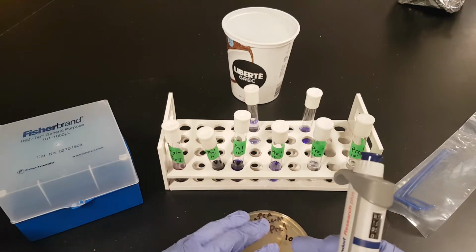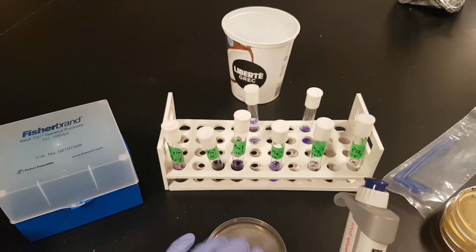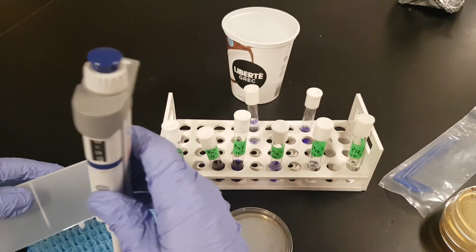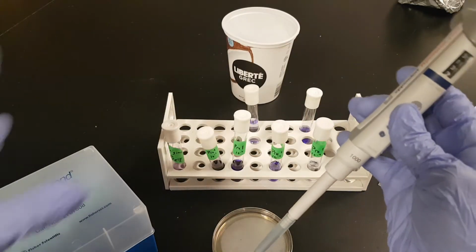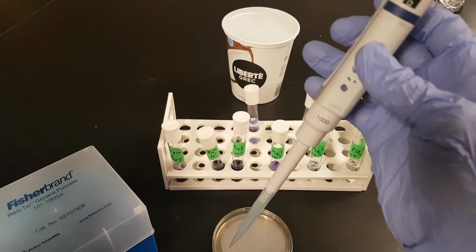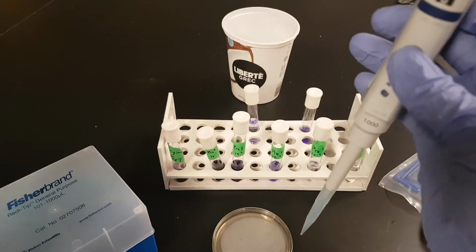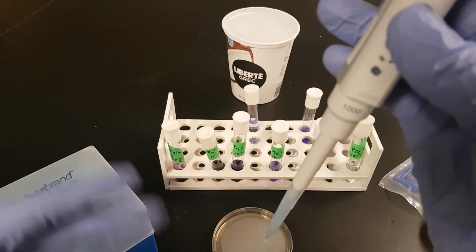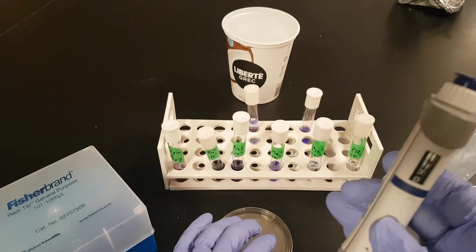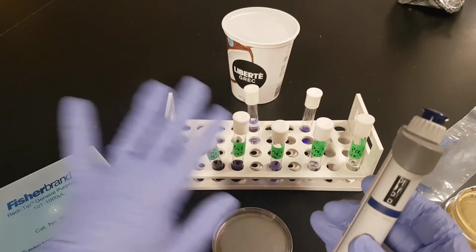And here's how we do it. Take your plate, you turn it over, put the other ones out of the way, because we're going to be, well, dispensing stuff onto it. Okay, make sure everything is ready to go. Go and get your tip. Make sure it is sterile. And some of you may have read an older version of the manual that says that we're going to be starting at the most dilute and working up. We're not going to bother with that. It complicates things. It makes it more likely you'll have cross-contamination. But most importantly, if you're not working quickly enough, then it's very possible, especially in the winter where the air is dry, that your first sample will dry out on the plate and you won't be able to spread it.